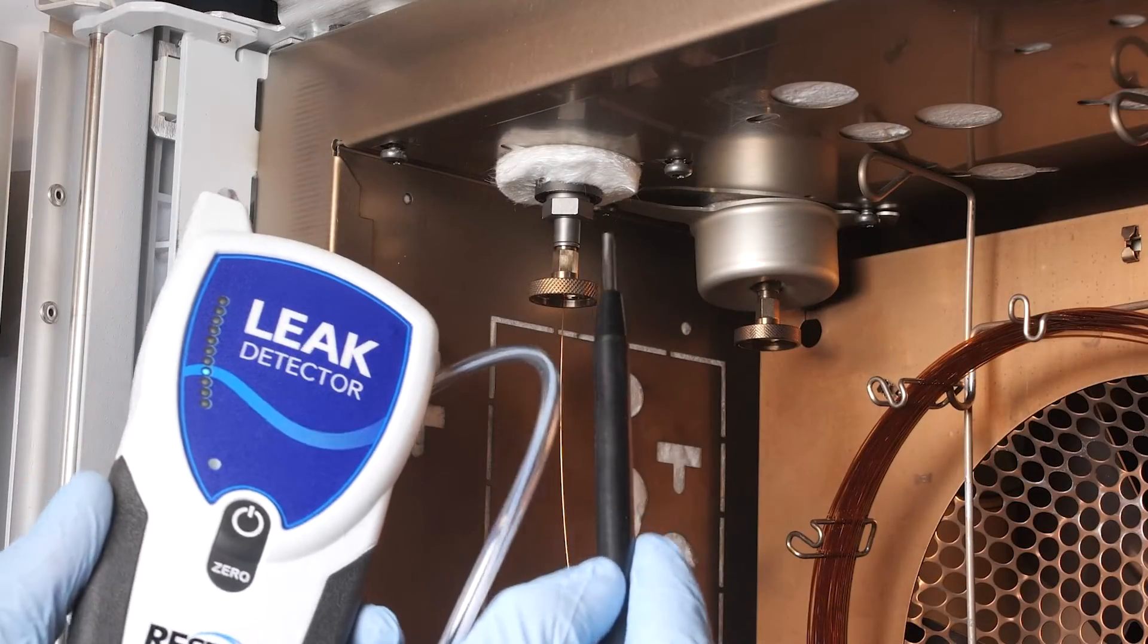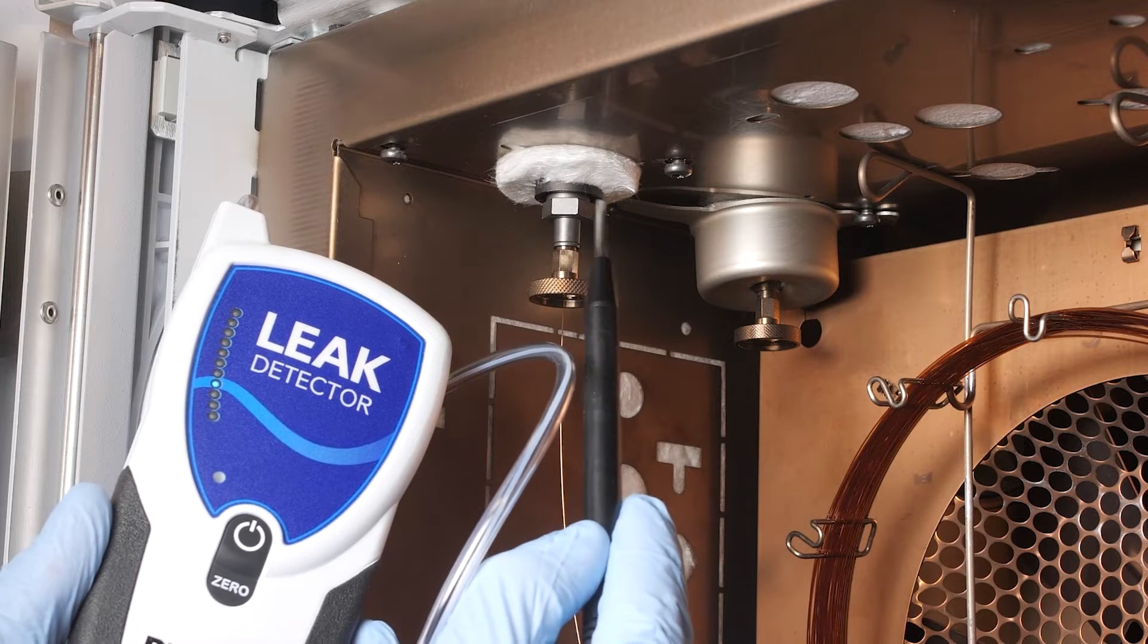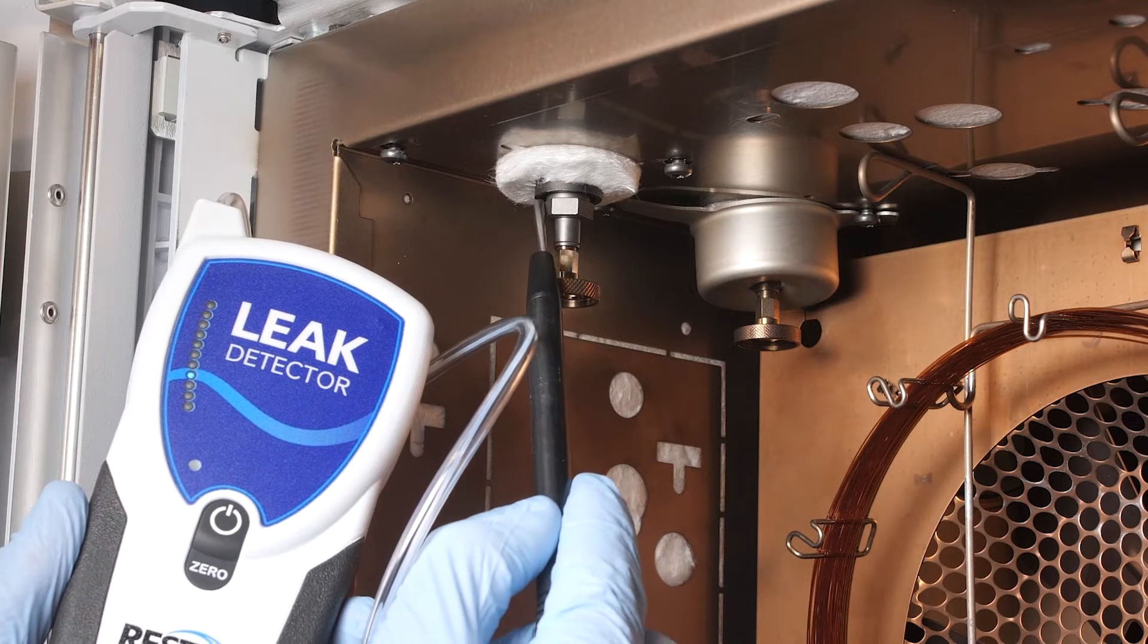Pay close attention to critical seals and valves, especially whenever you perform any maintenance. We recommend leak checking as part of your routine maintenance to help spot leaks early and ensure high-quality chromatography.